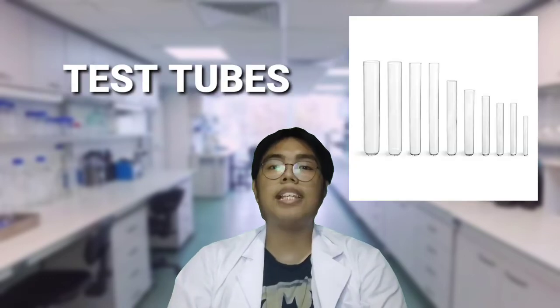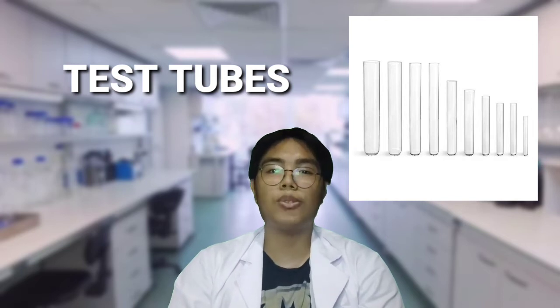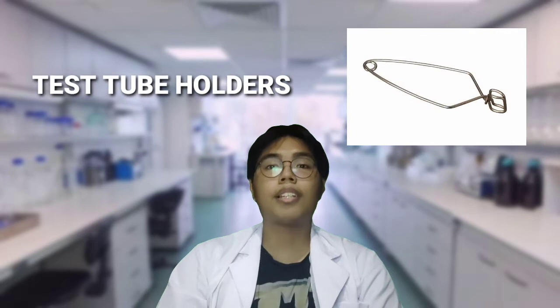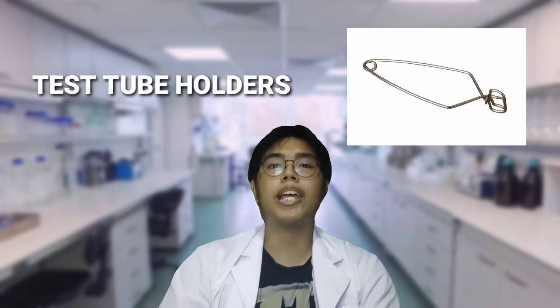Test tubes. These tubes are used in a lab to hold, mix, and apply heat to small amounts of chemicals and samples. Test tube holders. These holders are used to hold the test tube during experimentation when touching the test tube is hazardous.